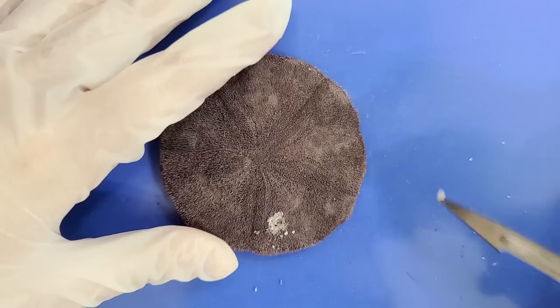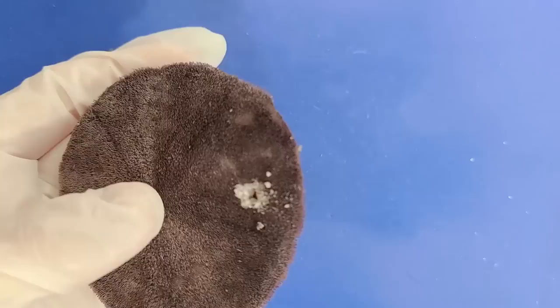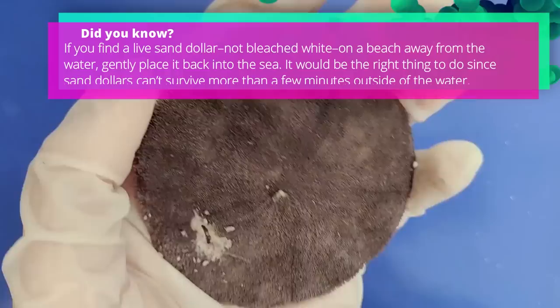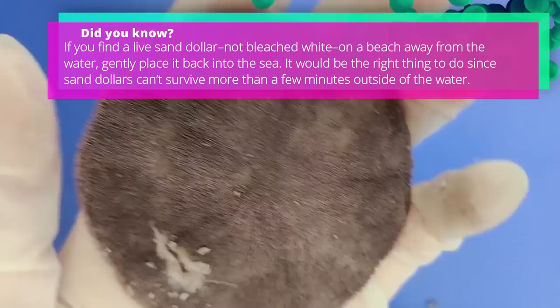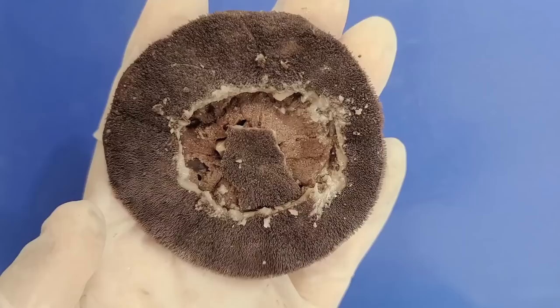Now that I've chiseled out a square window in the test, I'll dig a little more to create space for the scissors to go in. We take our scissors and carefully cut around the aboral surface, leaving the oral surface intact and not cutting too close to the center. Now that I've removed parts of the test, you can see the internal structures.